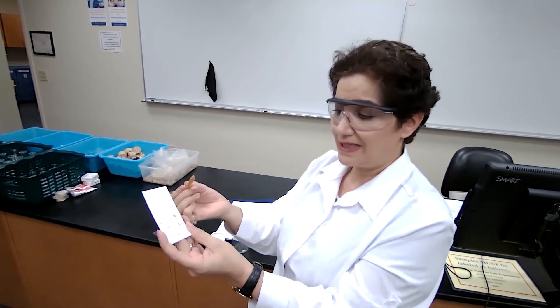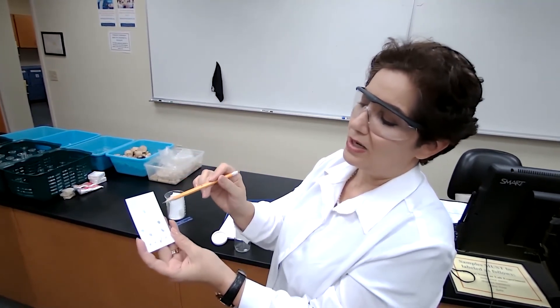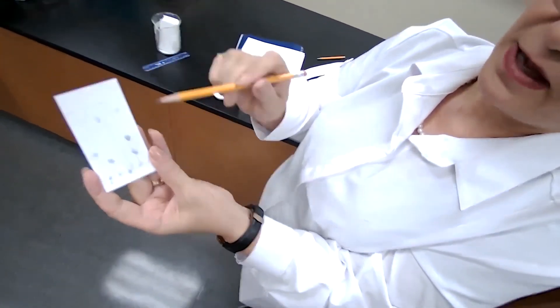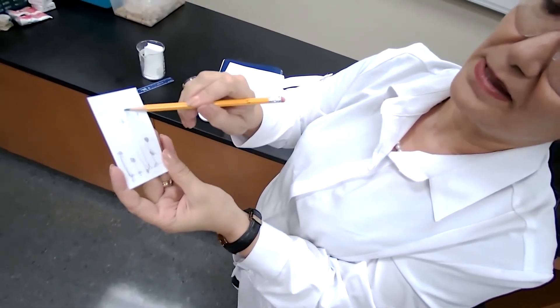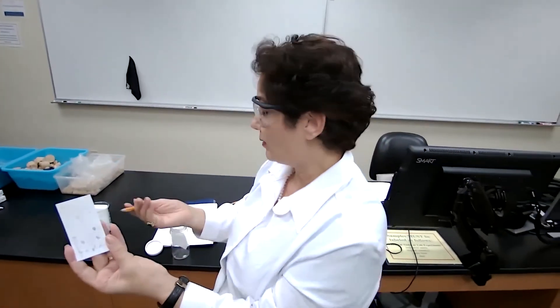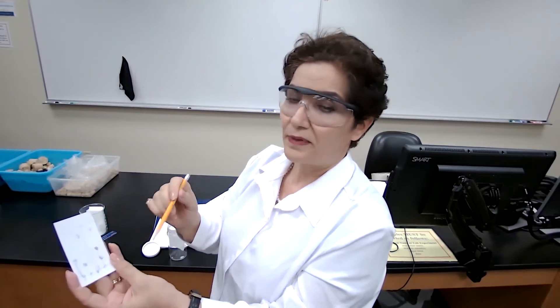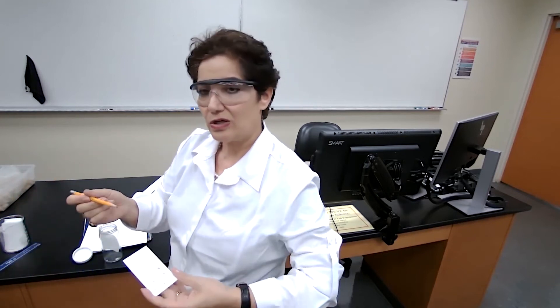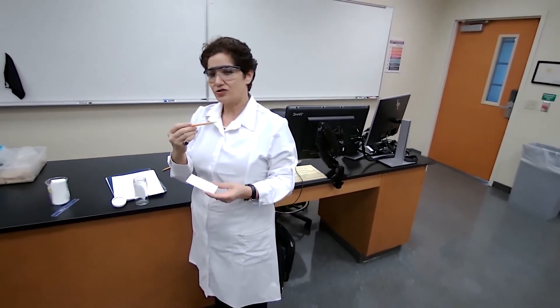Visually you can see if they give different colors. You can also calculate the RF value: RF is the distance traveled by each sample divided by the distance traveled by the solvent. We calculate the RF value for each compound and then compare the RF of the unknown to the RF of each known sample to identify the compound.